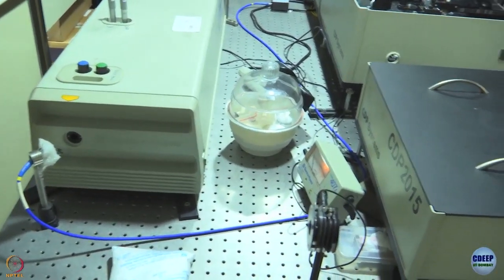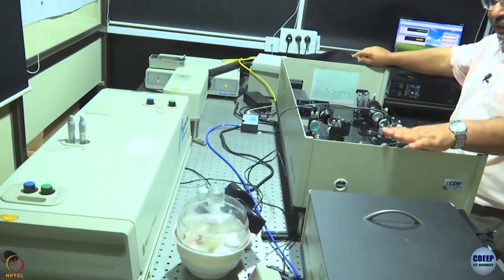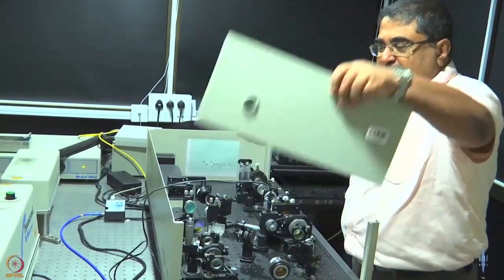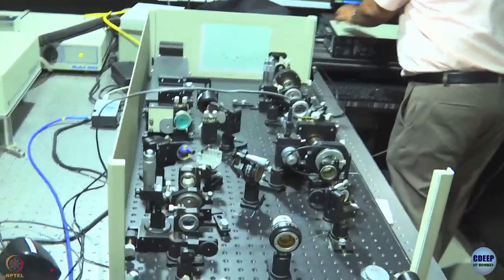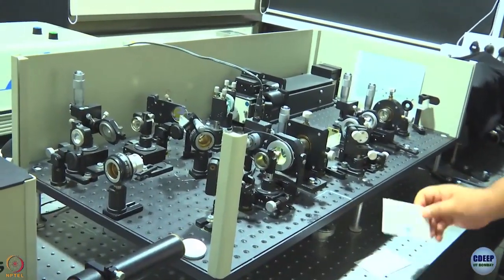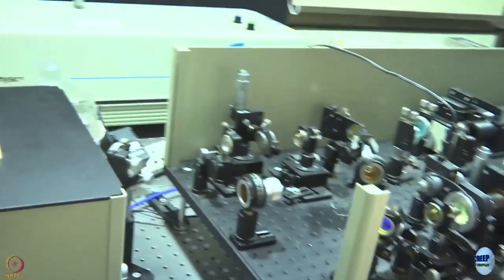This is the FOG 100 spectrometer where the experiment is actually done. Let me remove the covers so you can see a little better. This here is the optical unit. Laser light is supposed to come from this direction. Let me show you the red light — you see the red spot? That is the output of the titanium sapphire laser. To your eye it seems like light that is always on, but actually we have 100 femtosecond pulses coming at a repetition rate of 76 megahertz — too fast for our eyes to distinguish, which is why it looks like continuous wave.